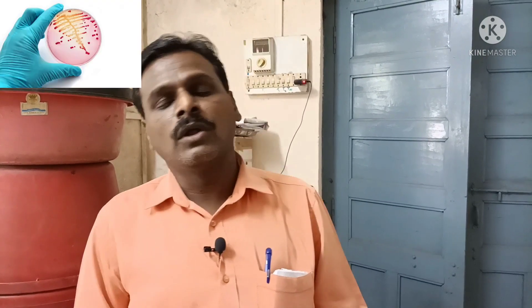Nutrient broth and nutrient agar are used for the isolation, cultivation, and maintenance of microorganisms. They can also be used for the enumeration of microorganisms present in food, dairy products, sewage, and different samples.